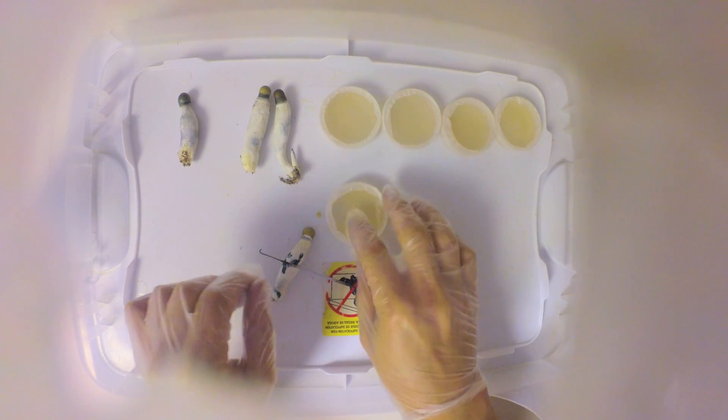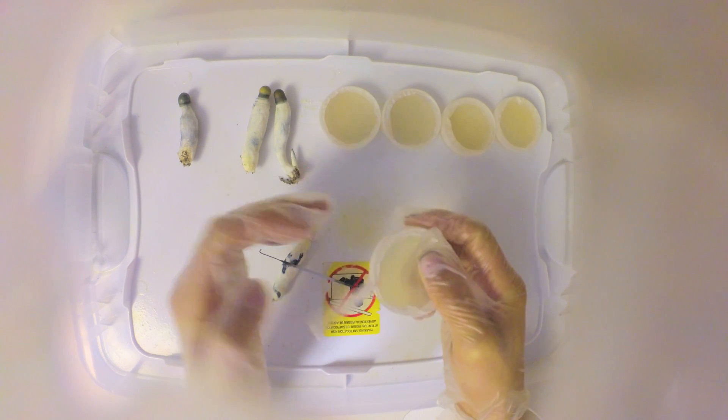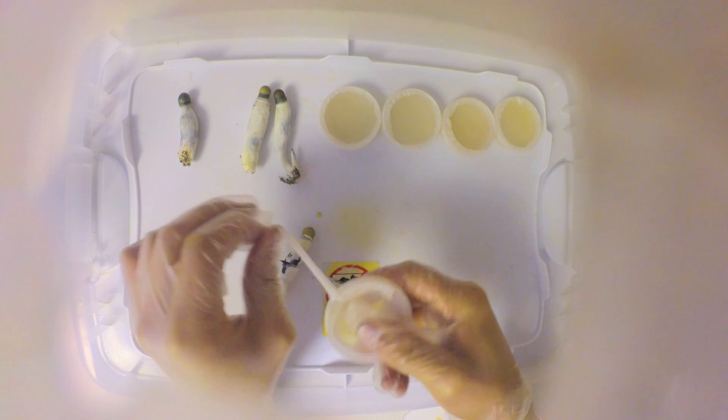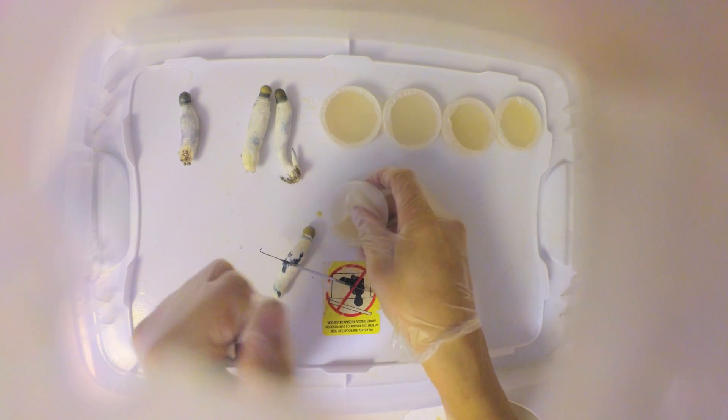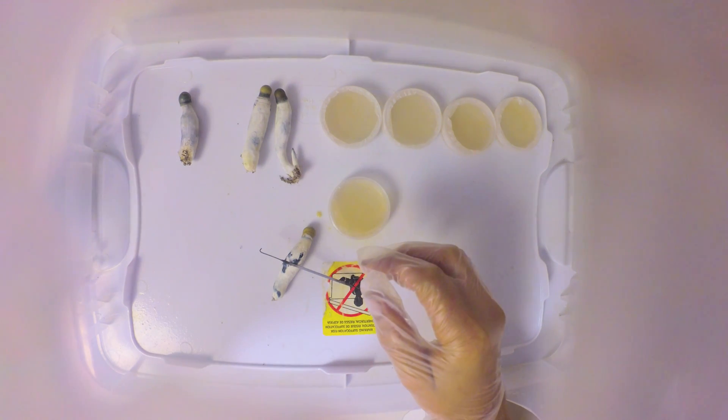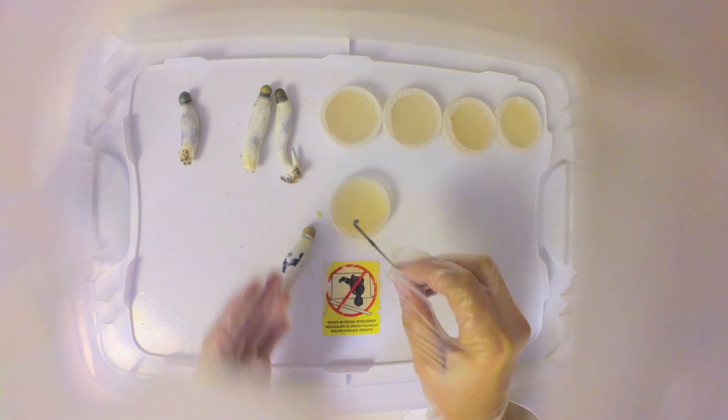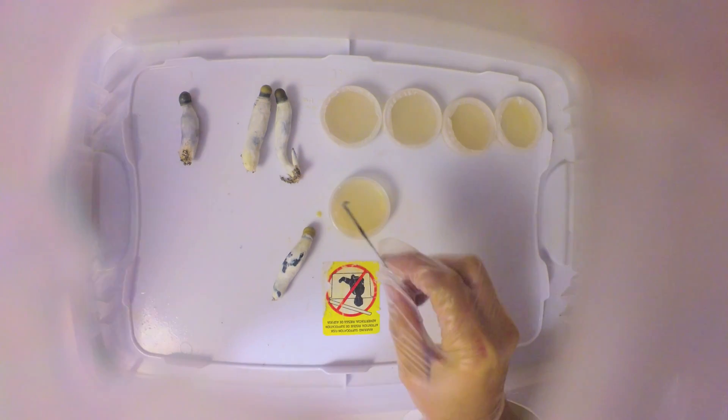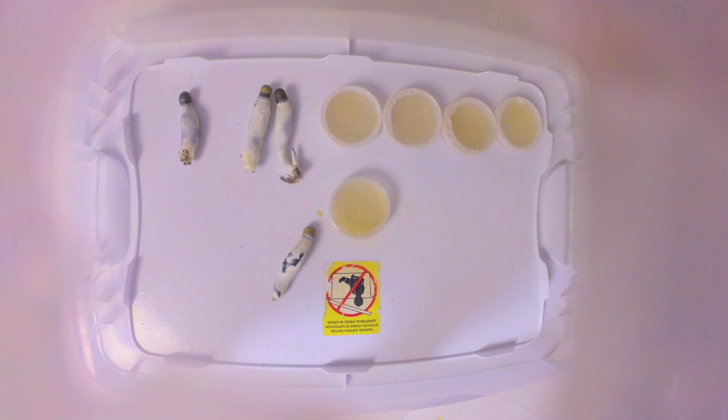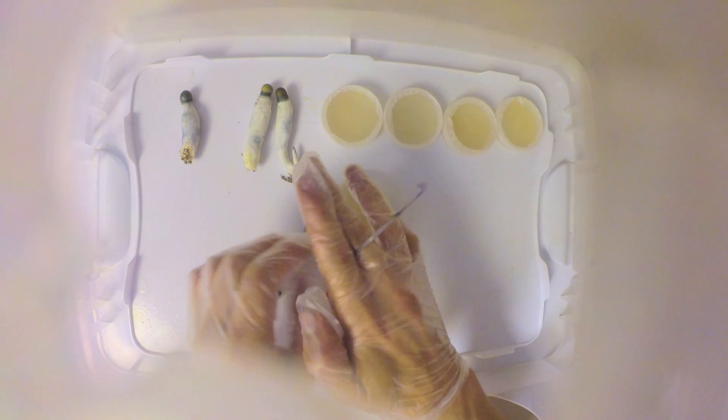I'm gonna take off this tape right here so I can get ready to inoculate it. Some people save their tape, I'll just discard it and put new tape on. Before I do this, I'm gonna sterilize my scraper one more time.